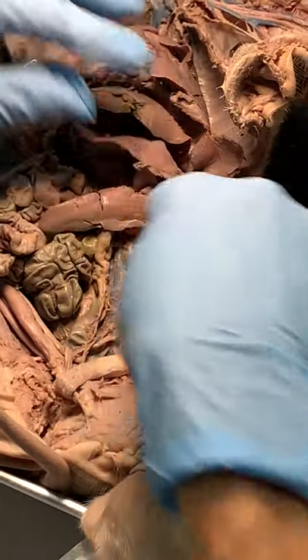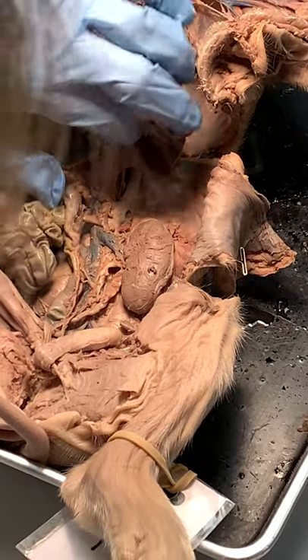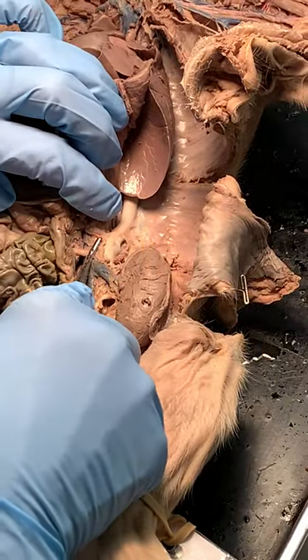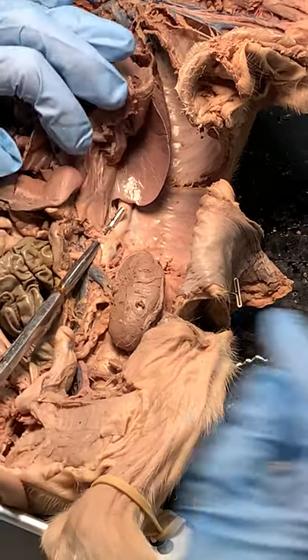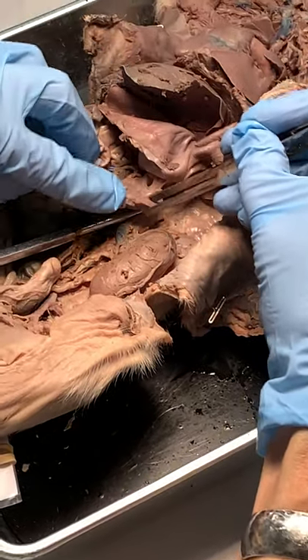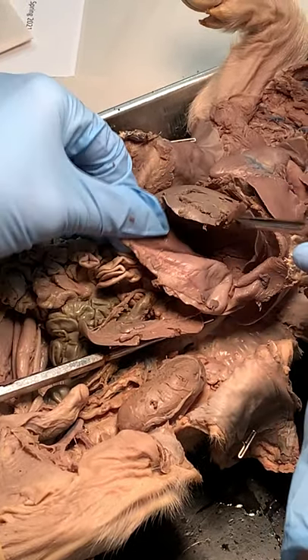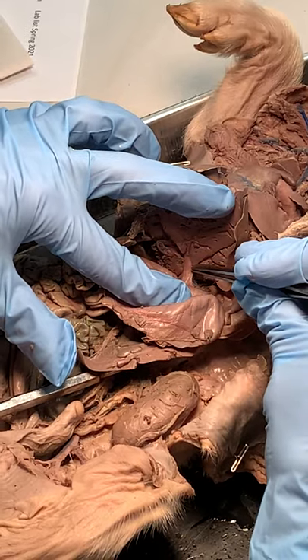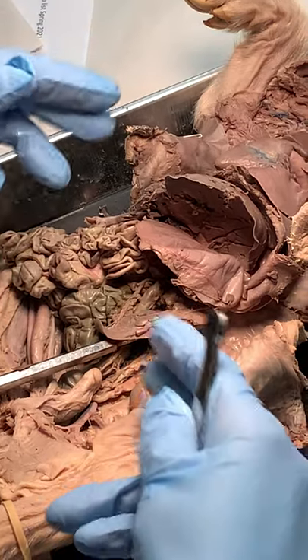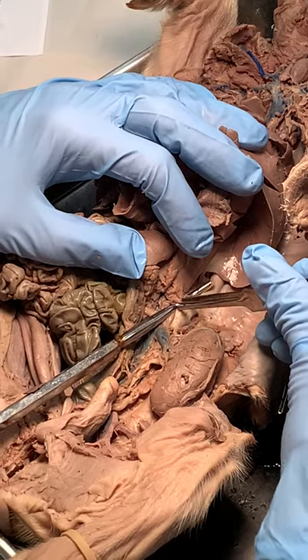There it is, right around the pancreas. I want to feed three organs, and the way I'm going to feed those is with this branch called the celiac trunk. It's going to make a red splenic artery, a red gastric artery, and a red hepatic artery. So those are the three branches. You don't have to be able to see those this time, but I just want to show you that they do exist — they all come from this celiac trunk.